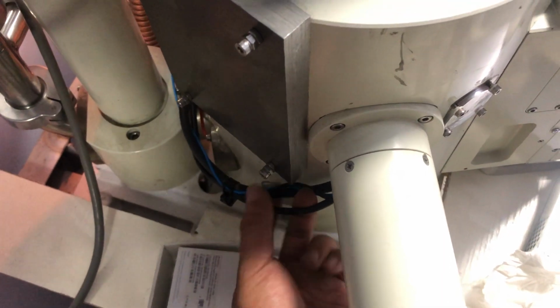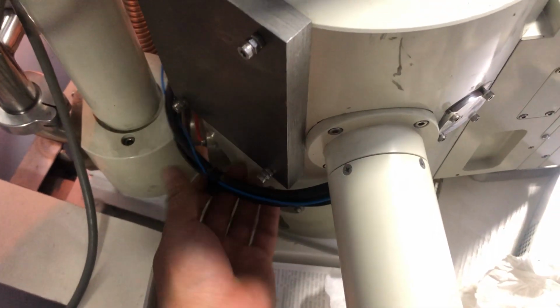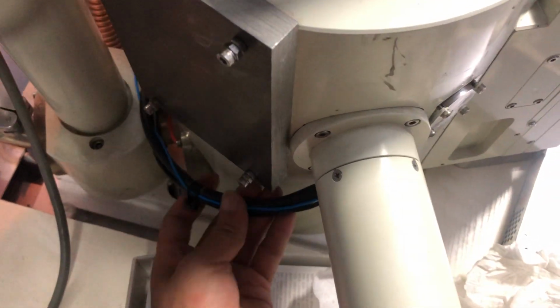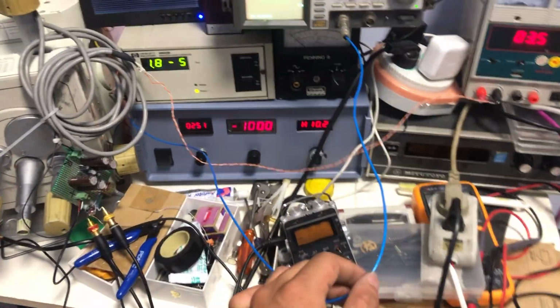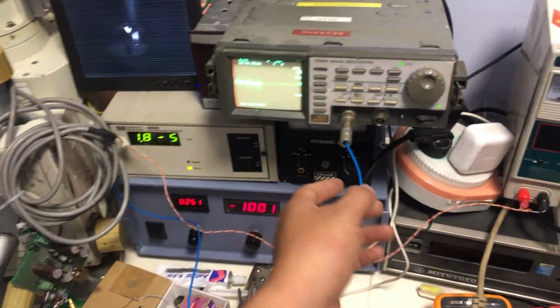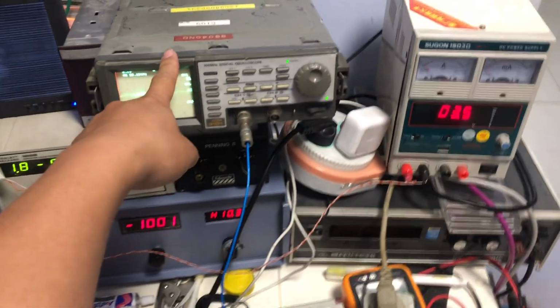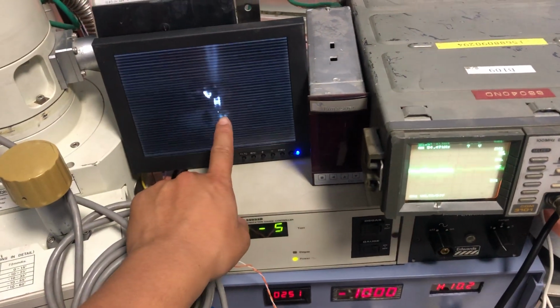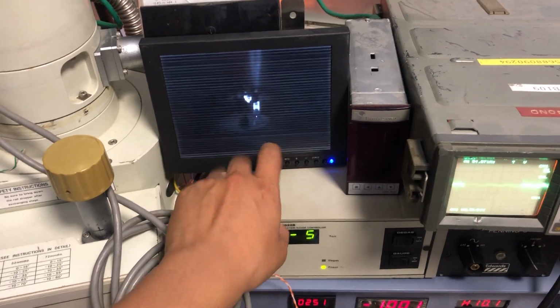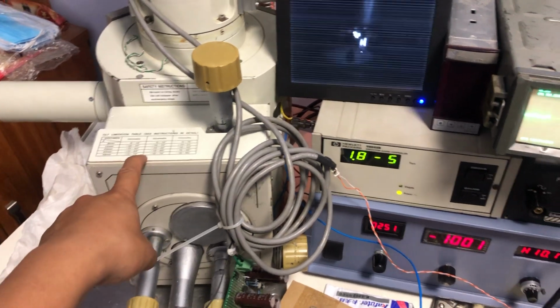minus 10 kilovolts. Okay, here the blue wire is the output of the photomultiplier tube. Okay, here is the photomultiplier tube output, and I connected it into an isolated oscilloscope. Here is a video camera showing us what's happening inside the sample chamber.